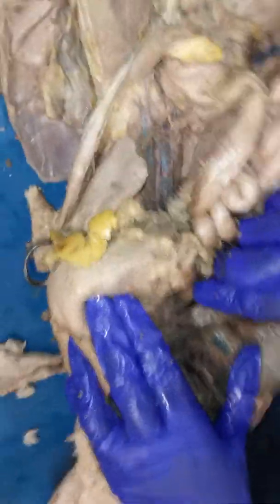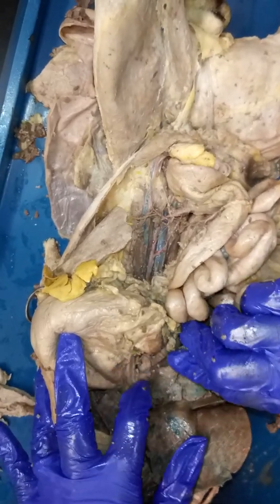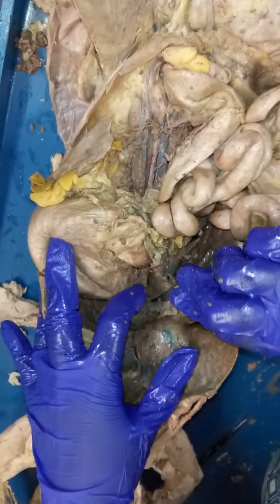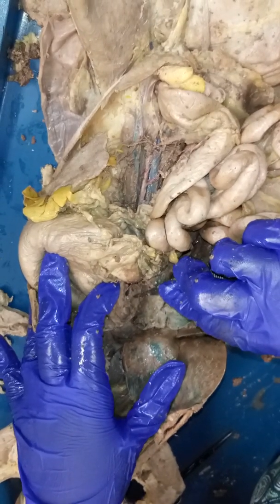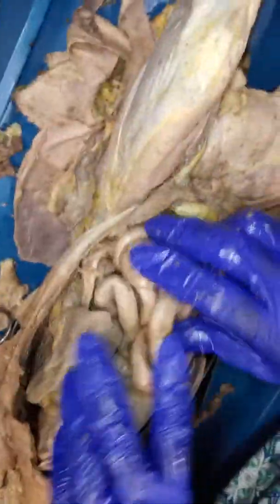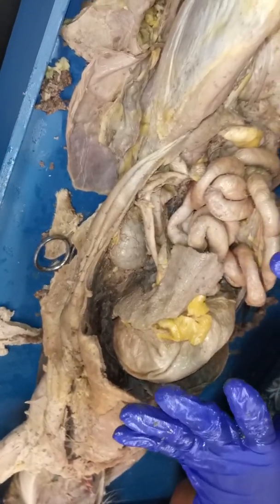Okay, sometimes in some cats the hepatic portal vein is nicely dyed with a color, and this particular one it doesn't. But if you find this major vessel that's going into the center of the liver, then that's going to be the hepatic portal vein. Now the mesenteric branches that drain into it, in this particular cat, you won't be able to see very well. Okay, and so in terms of the abdominal region, this is probably one of the best looking cats.